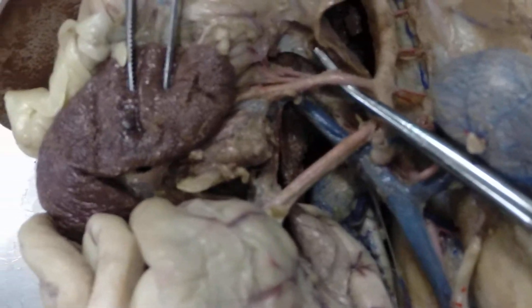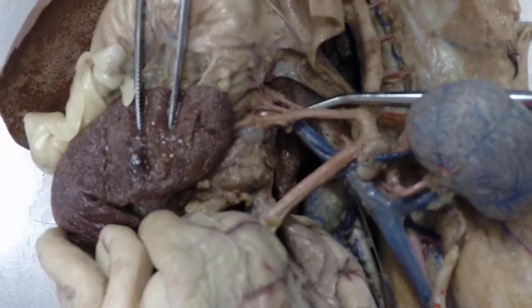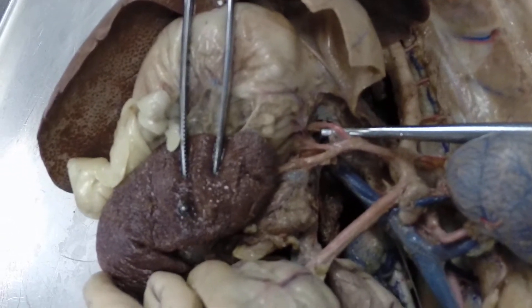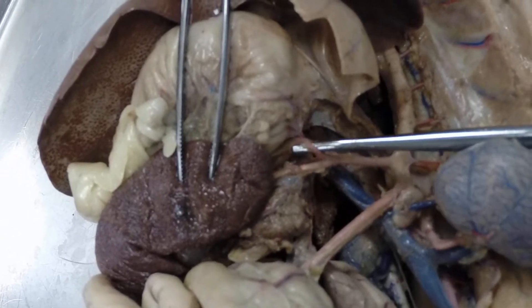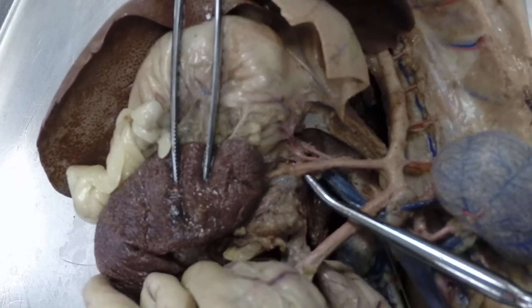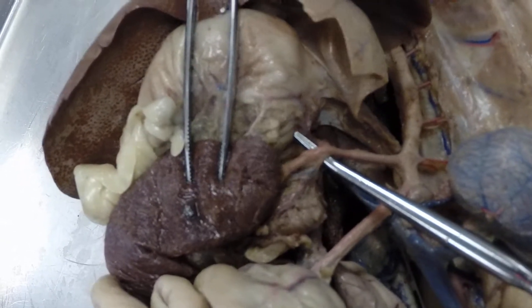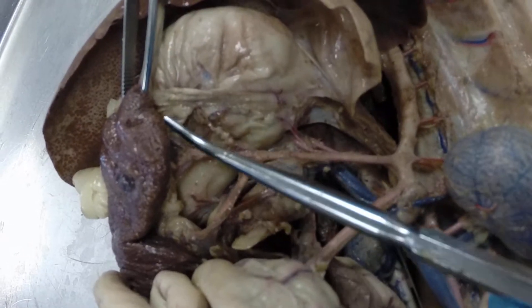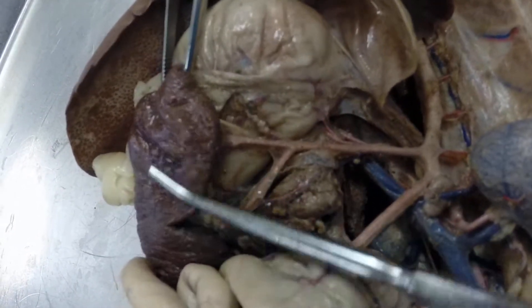The celiac artery has three branches coming off it. The first is called the hepatic artery. The second branch is the gastric artery. The third branch is the splenic artery, which is going to branch a few more times going to the spleen.